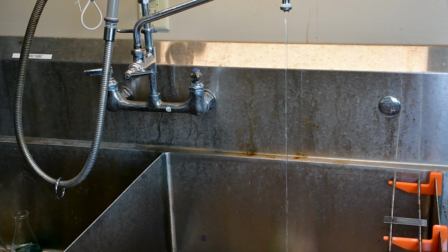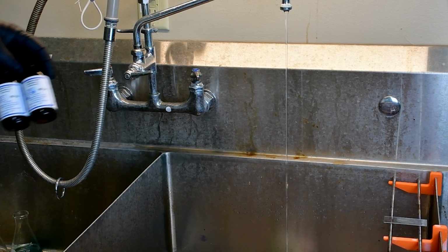Now, the second stain I'm going to show is going to be the Neisser stain. This is going to be very similar to the Gram stain in that it has a primary stain and then a counter stain. It's a lot less complex than the Gram stain, though. It is going to involve, again, a pre-purchased kit called the Neisser stain kit. You can typically find it in a few different spots.